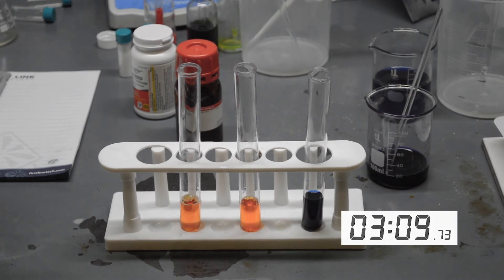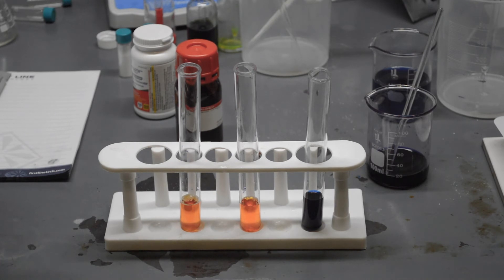As you can see, if anything the reaction of the Dahlgren where the B1 and A mixed and sat went a slightly bit faster than the fresh-mixed Dahlgren. That's probably a result of the lye — the B1 — mixing better, having more time to mix and making a better solution, so we get more peracetic acid out of it. Again, you see they both oxidize within five minutes, going from blue to green to orange. Even though we wouldn't recommend pre-mixing because you will then be carrying around a very caustic lye solution, it doesn't have any noticeable effect on the efficacy of Dahlgren.